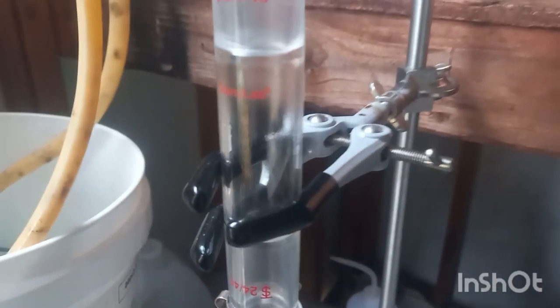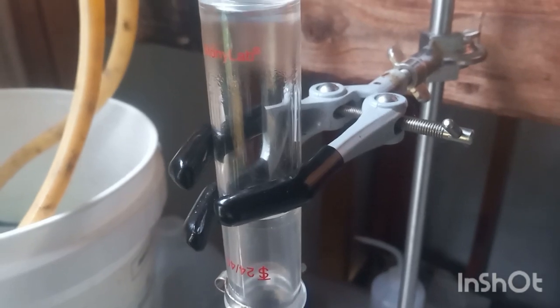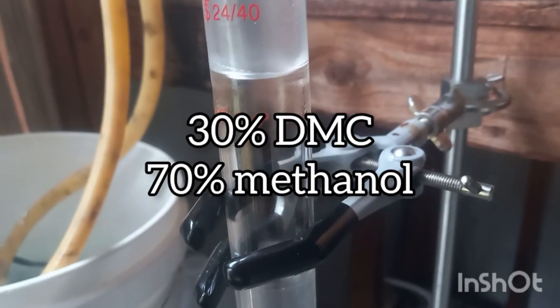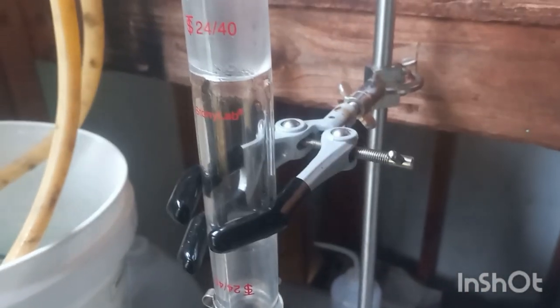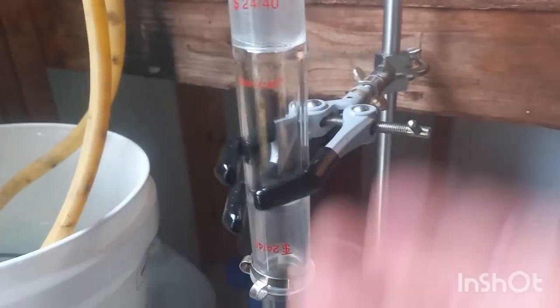So while we're at it, 63.4, I believe, is the methanol–dimethyl carbonate azeotrope, and that's what we're going to collect. It's very strange we have it all the way up here so far, so I guess that's probably the azeotrope, because it's pretty warm down there. But that's also why I extended the column.